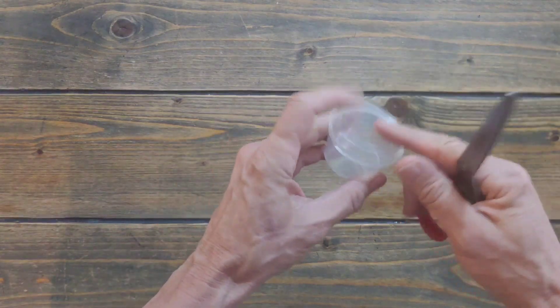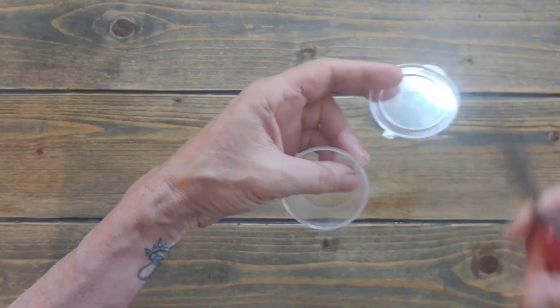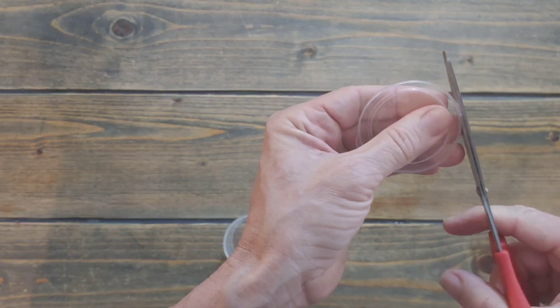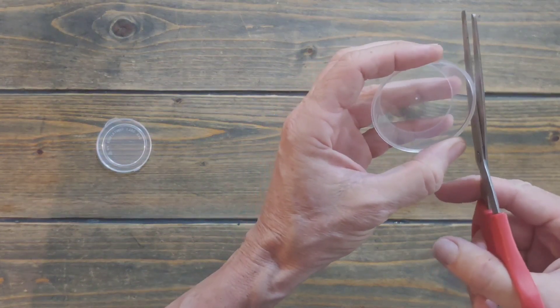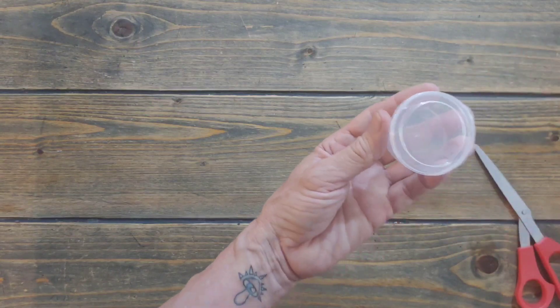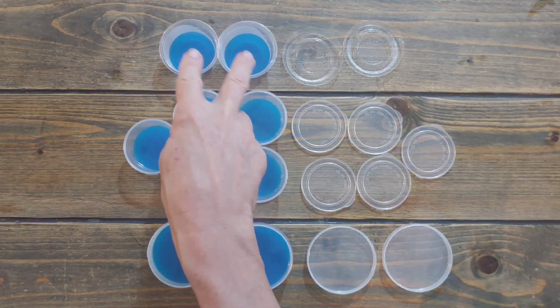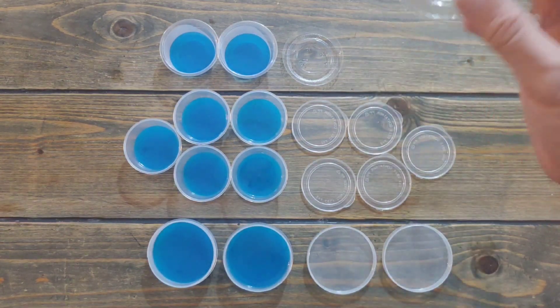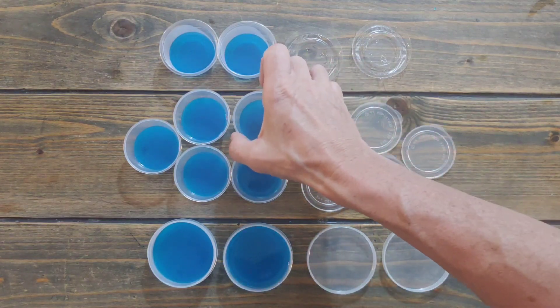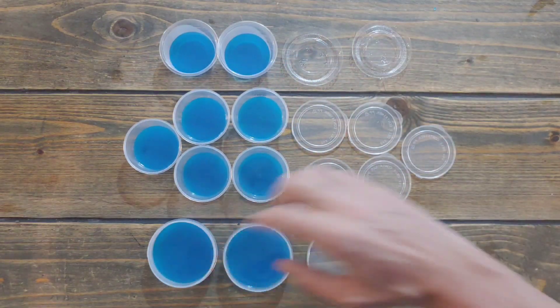To use these in the pressure cooker, I can't have the lid flapping around, so I'm going to cut those off. Then we can cover them loosely with aluminum foil and pressure cook them that way. So here's what we've got: two cheap ketchup cups of the flimsy kind, five of the PP5 condiment cups that are kind of thin, and two of my favorite PP5 cups.